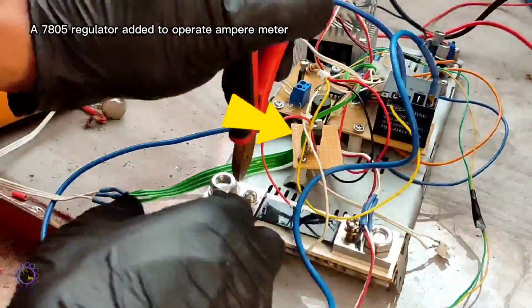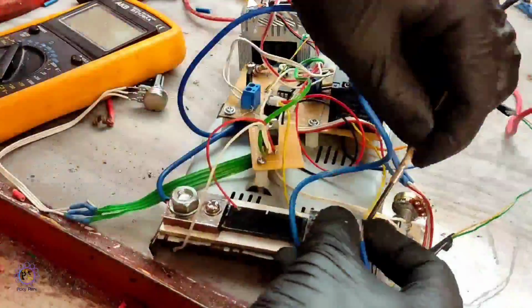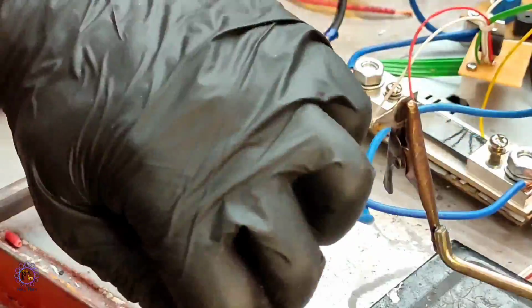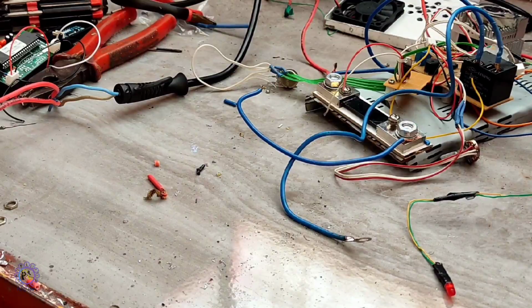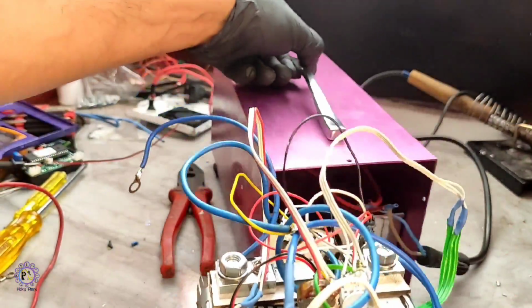Next the shunt resistor wiring was done. The output was soldered and ready to be tightened to the front panel. And rubber legs were screwed at the corresponding places. Here's the finished circuit, which just needs to be placed into the casing.